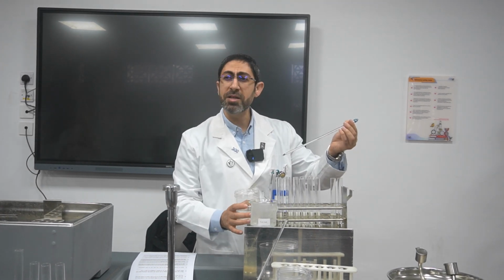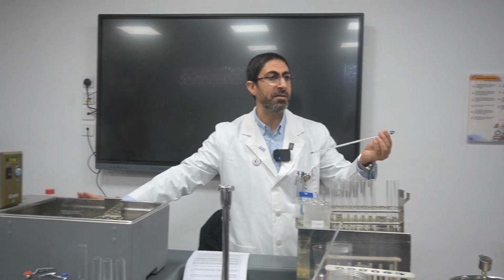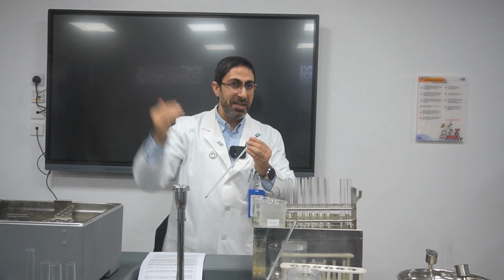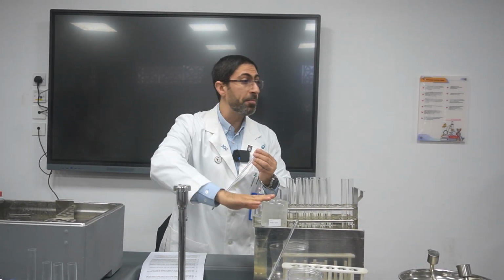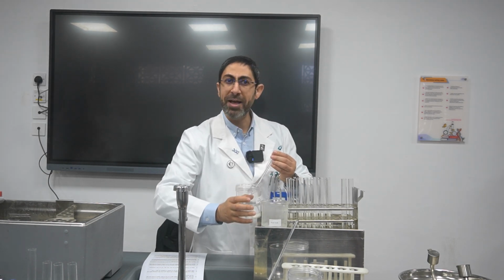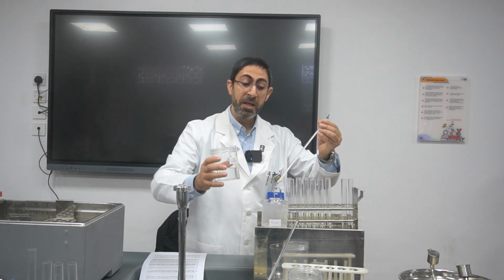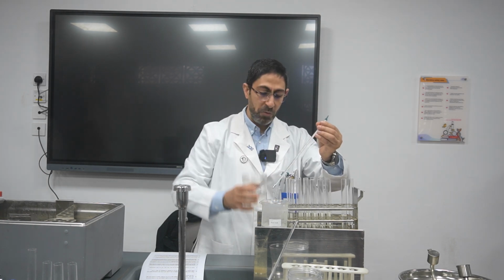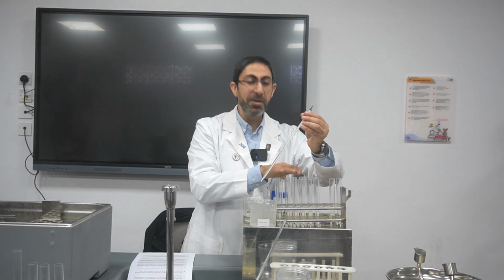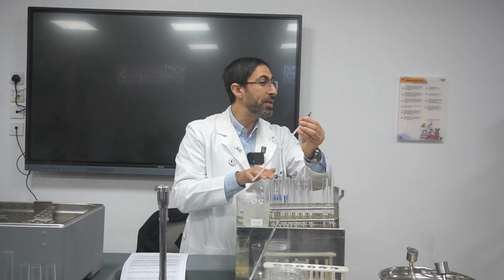Here the temperature of the water is 100, according to the reading of the thermostatically controlled water bath. So I will start from 100 downward. If I want to adjust the temperature of the water bath, I will add water to decrease it from 100 to 80, measuring the temperature with the thermometer. Then I will add another amount of water for another run, which will be 70. If I add another amount of water, the temperature will decrease to 60, 50, 40, 20.